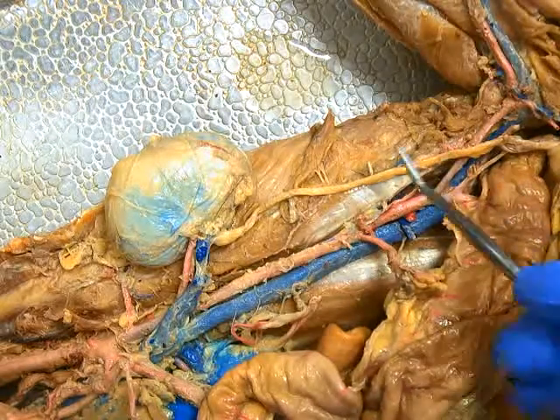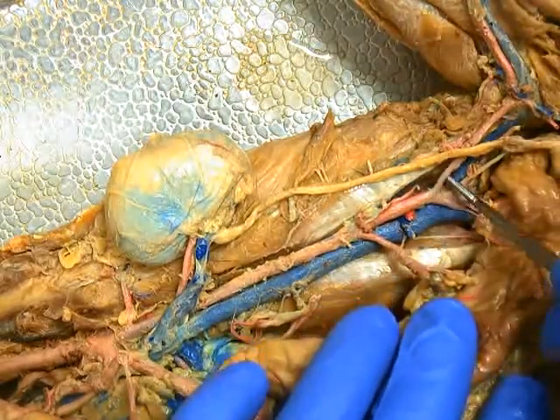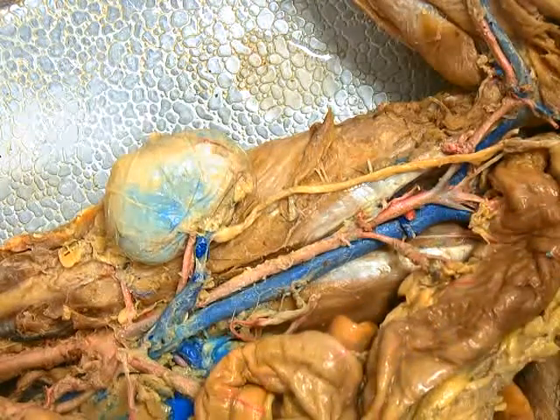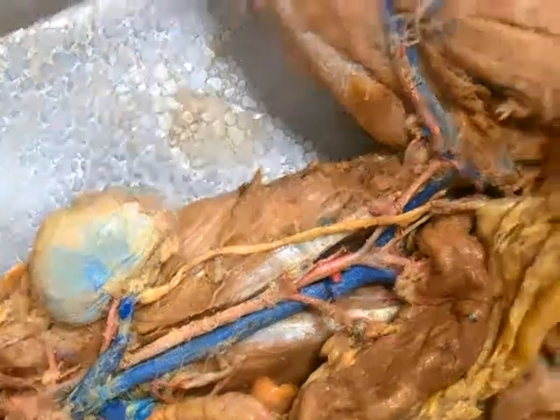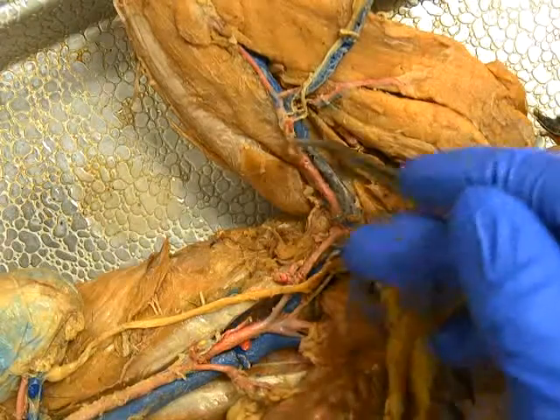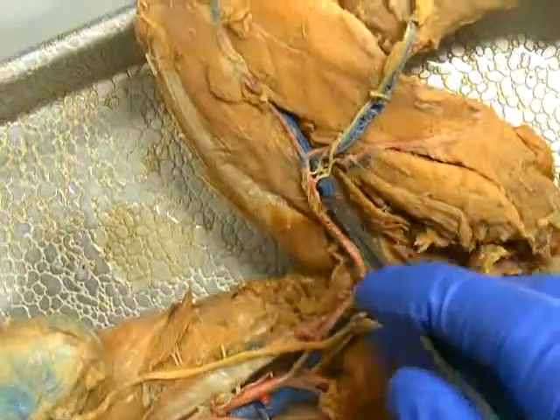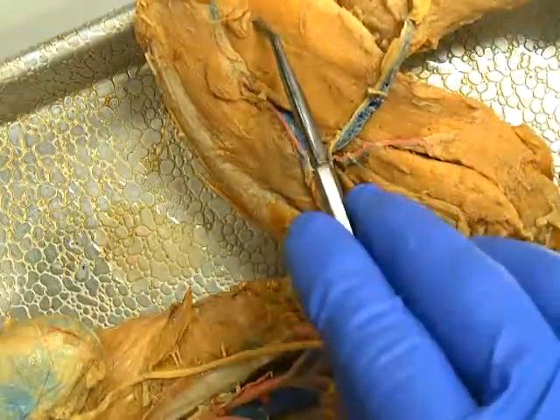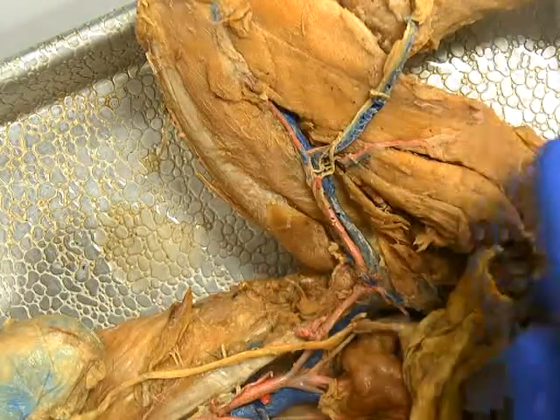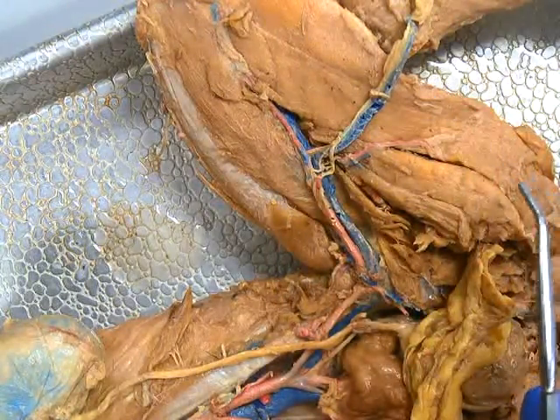The abdominal aorta continues, and at this bifurcation point, we'll see the left and right common iliac arteries. As we leave the pelvic cavity, we'll become the left femoral artery. Continuing on down: the left popliteal, left posterior tibial, and left dorsalis pedis will all be tested from the model.